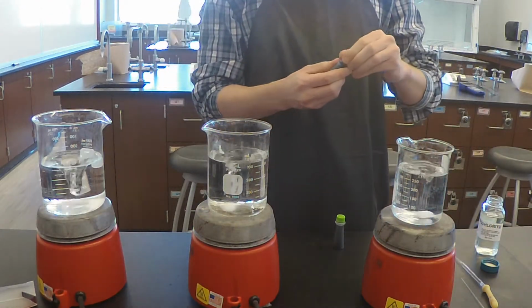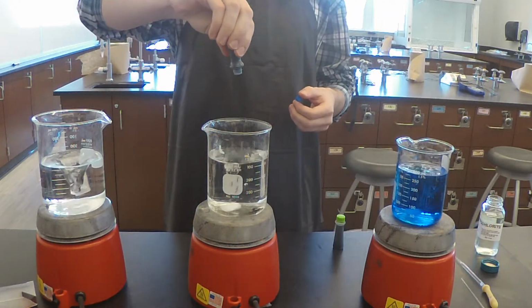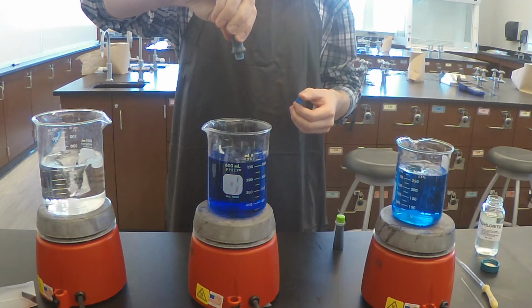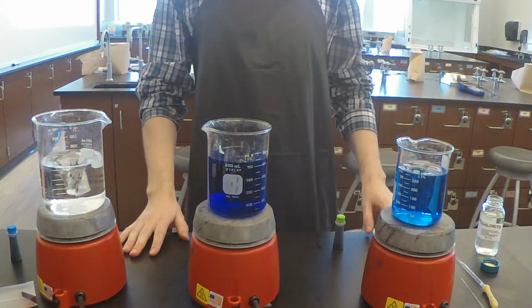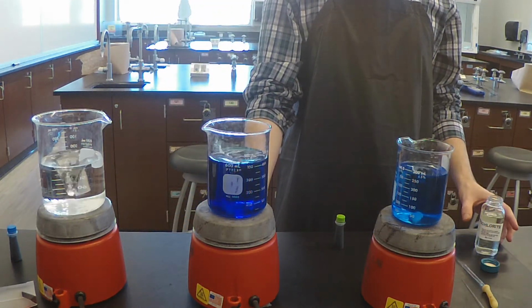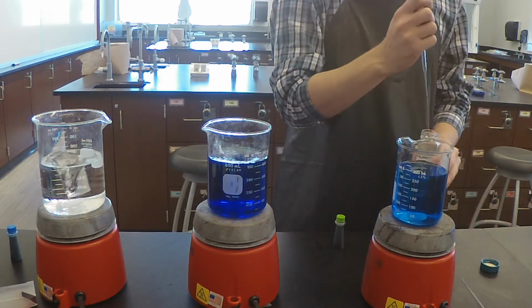Okay, so to this first beaker, I will be adding 1 drop of blue food dye, and to the second beaker, I will be adding many drops of blue food dye in order to indicate a higher concentration of food dye. I will then take bleach and add it to the first and second beakers, and we will observe how the reactions vary. Take a second and tell me how you think the 2 will vary and what your predictions are.